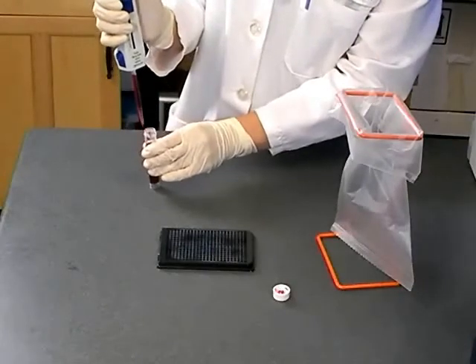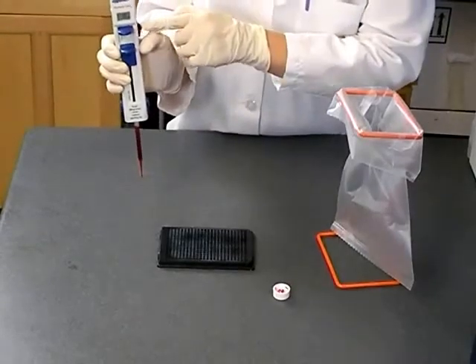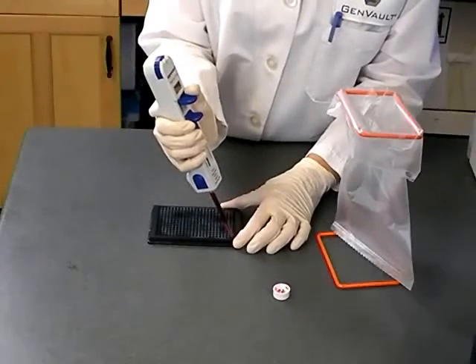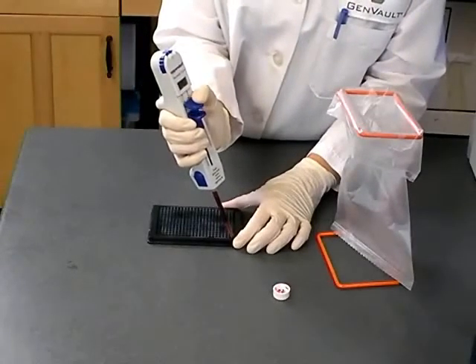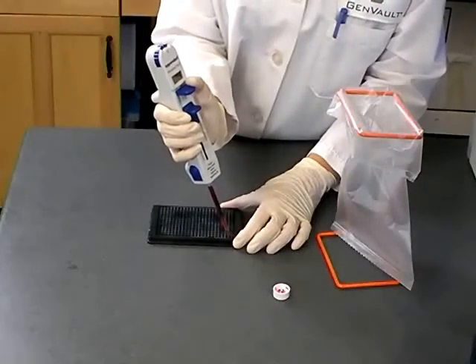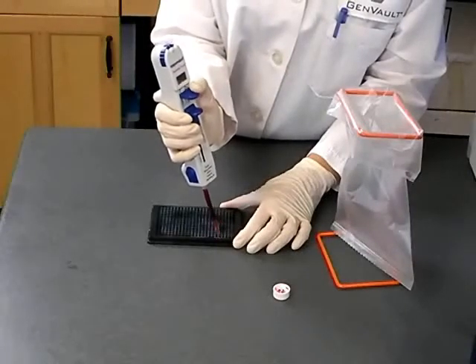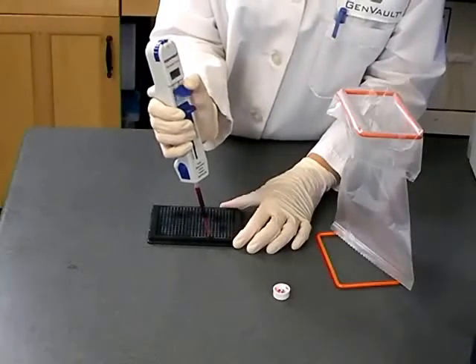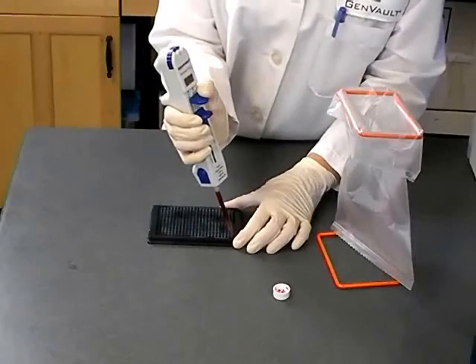The display will stop blinking. Now you are ready to dispense an accurate 10 microlitre aliquot. Carefully align the pipette tip with the first well of the GenPlate and dispense 10 microlitres directly into the centre of the element without touching the element. Repeat this step until you have dispensed nearly all of the volume in the pipette tip. To continue with the same blood sample, refill the pipette and repeat the steps for filling the pipette.